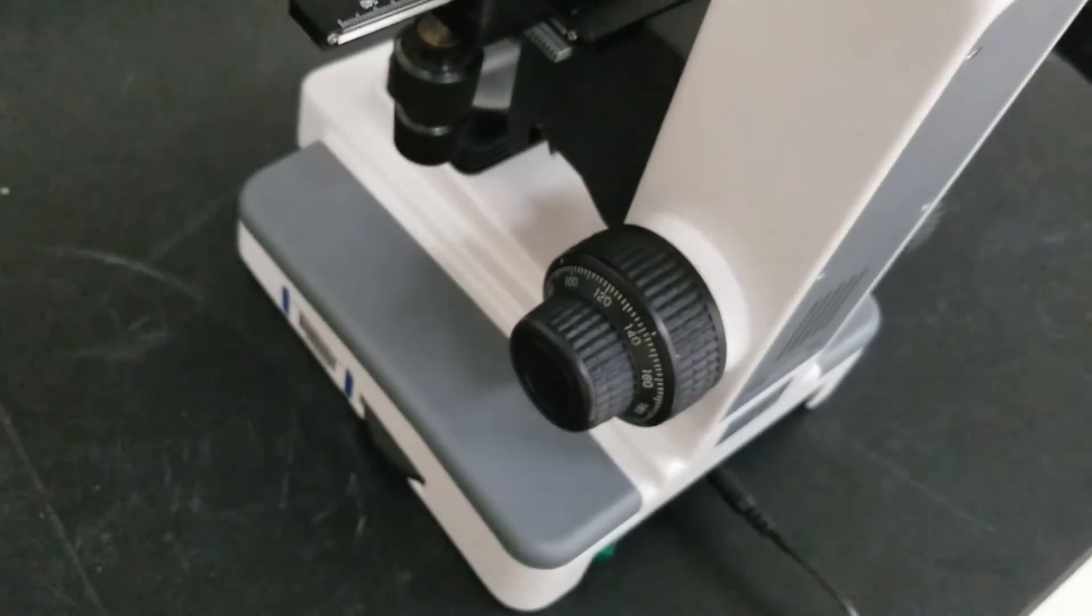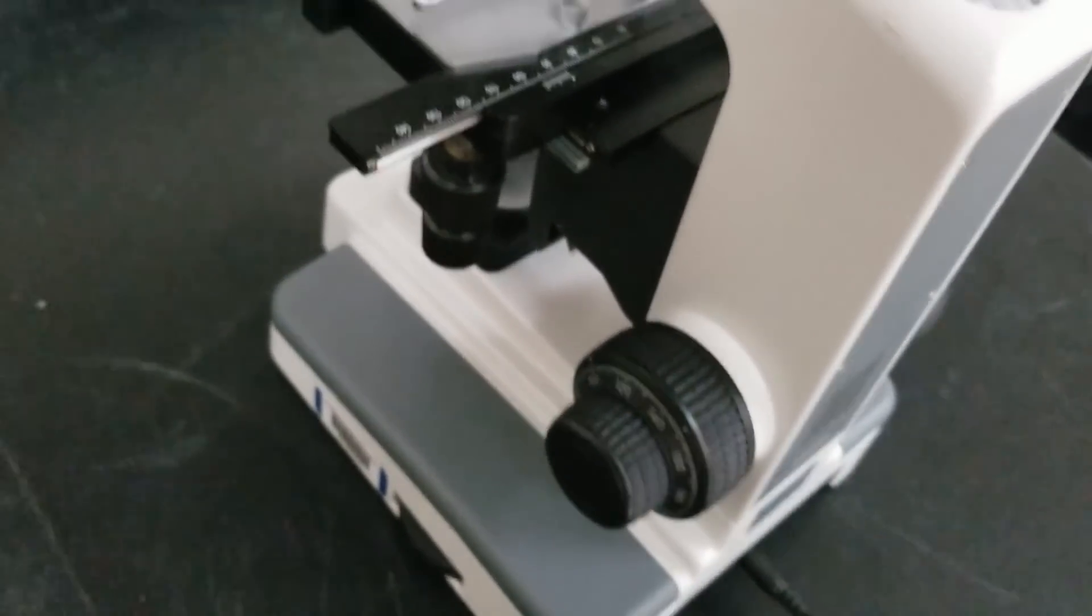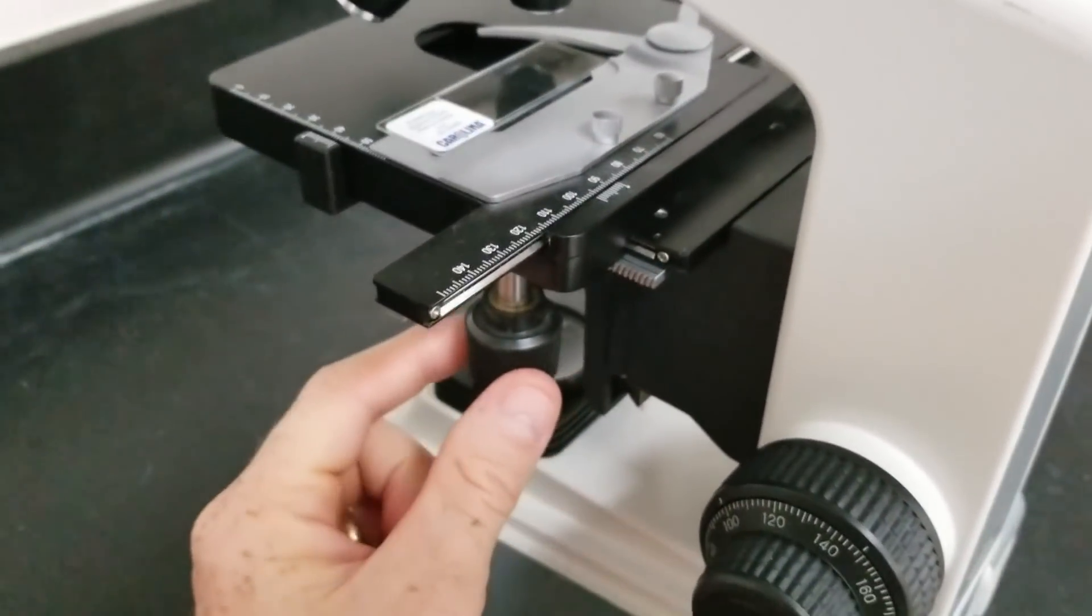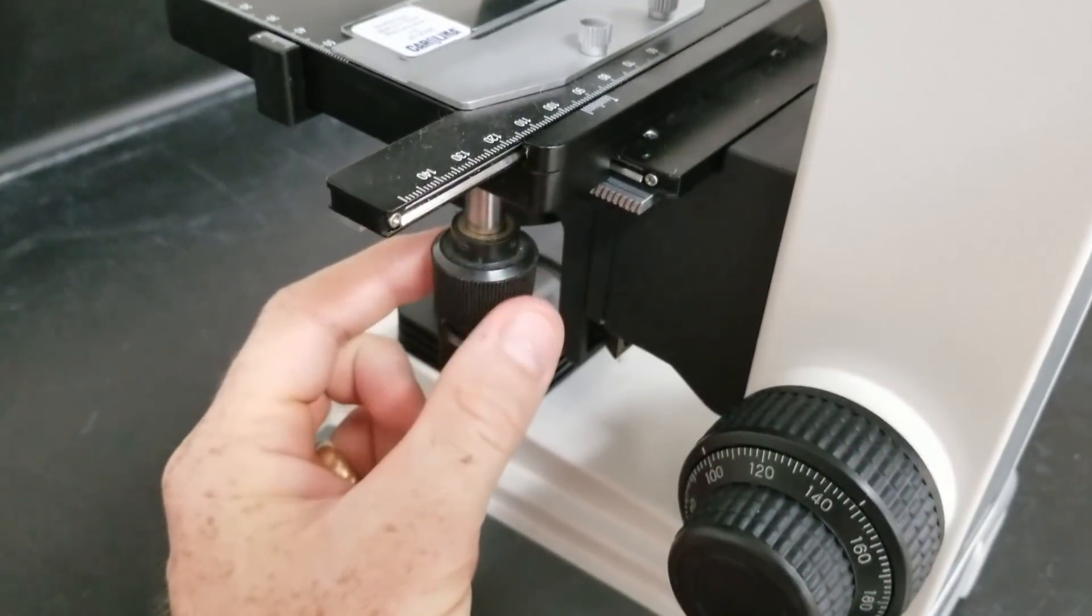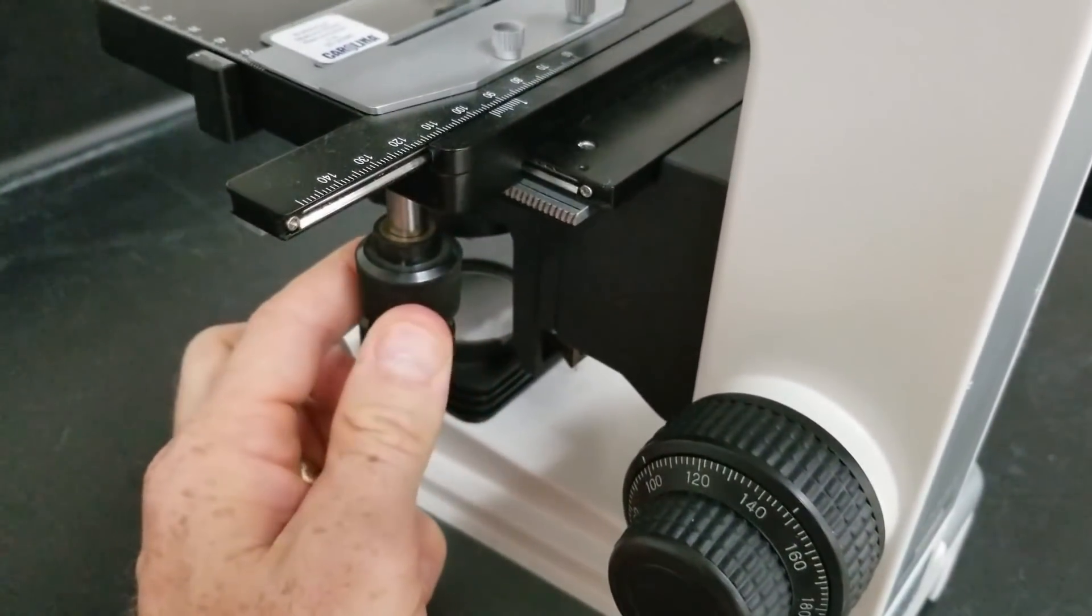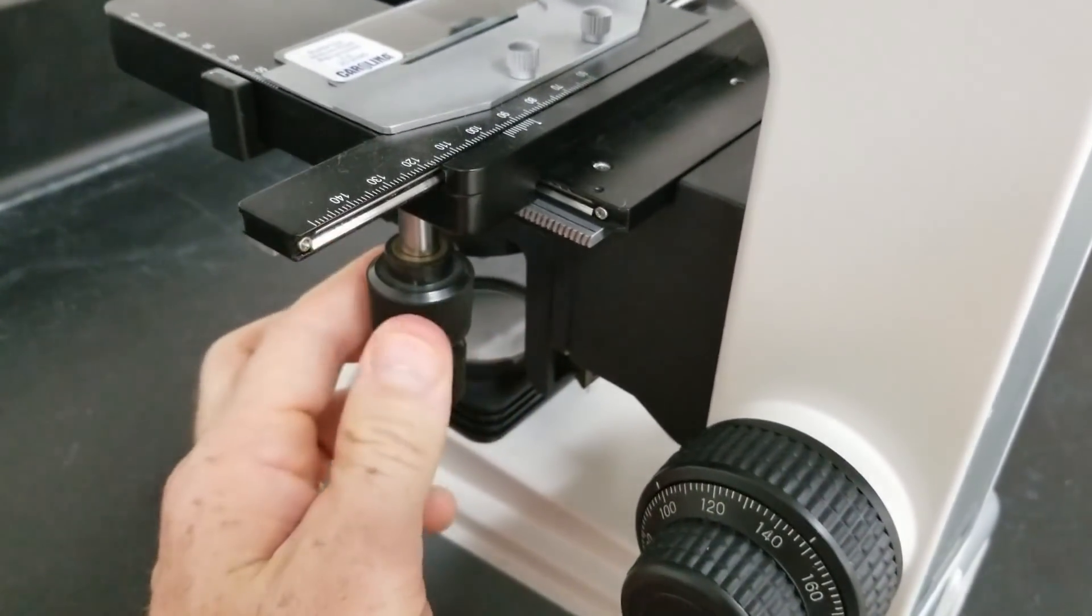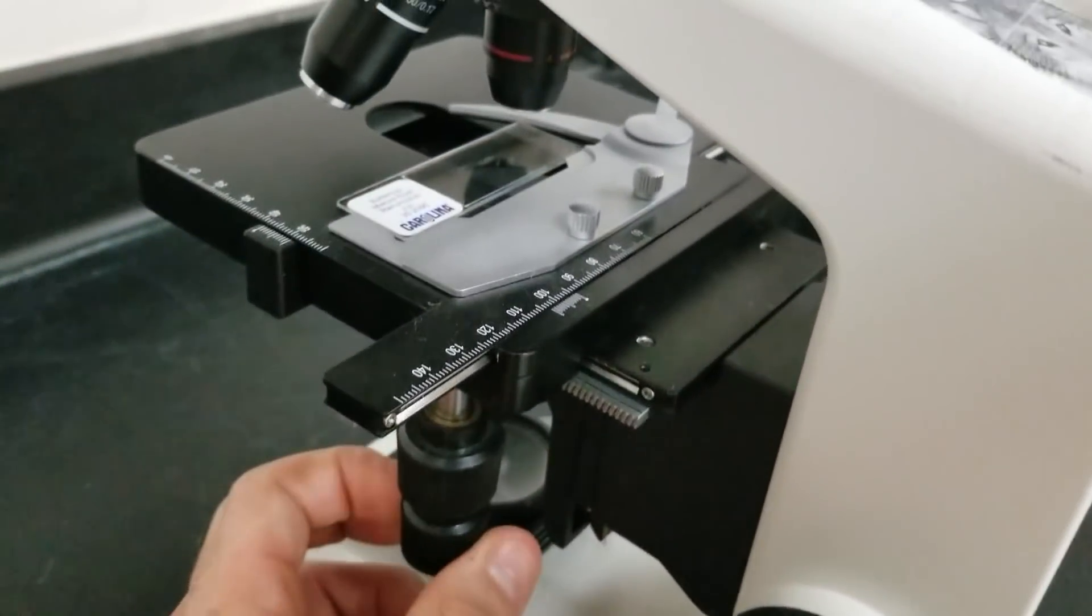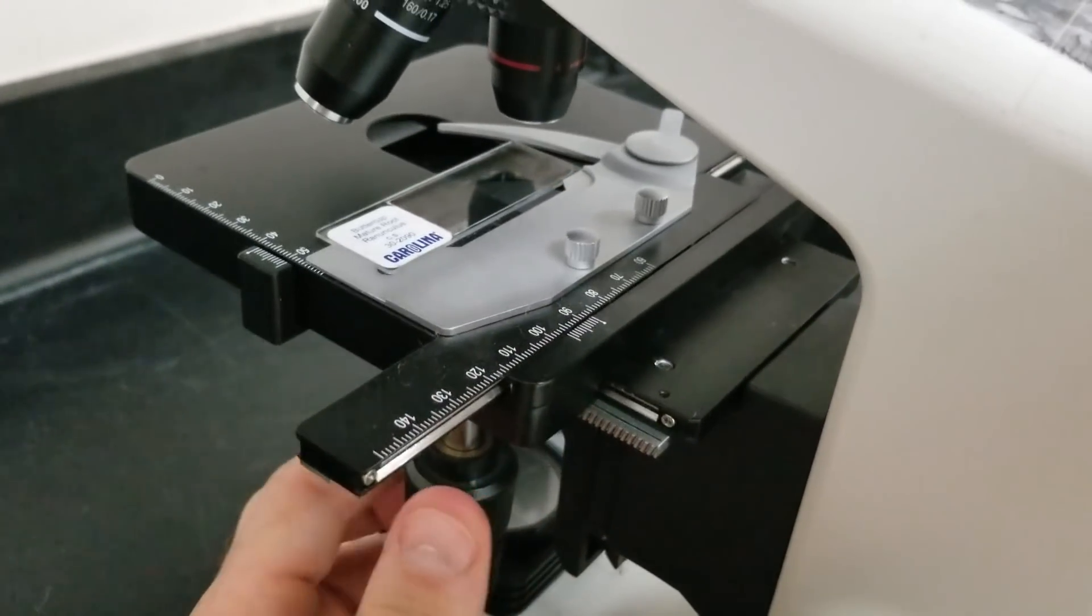Some of them will have a large and a small but it is all the same stuff. To move laterally like horizontal and vertical directions, you're going to use this right here. This is going to change the side-to-side movement of the slide.